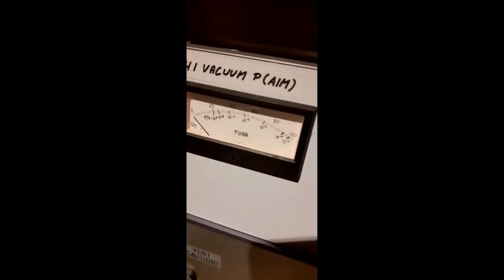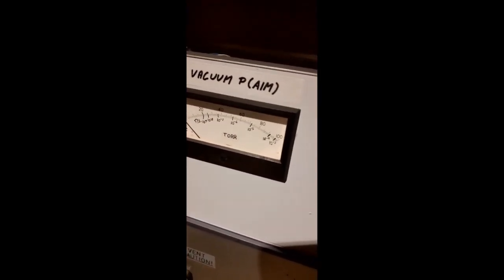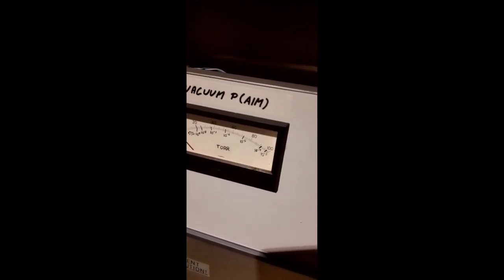And it's pretty simple, it's just a magnet drawing out ions like a Penning ion source, I think, and measuring the current in microamps, and then there's an electrometer that displays it as volts. So it's not advanced. Really all the science stuff and all the smart stuff is already in that box, and that box.